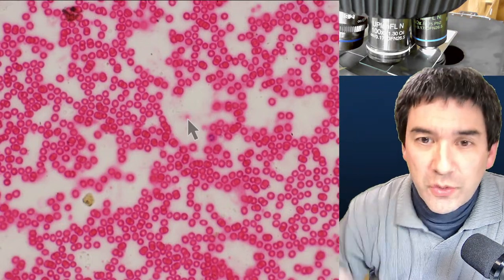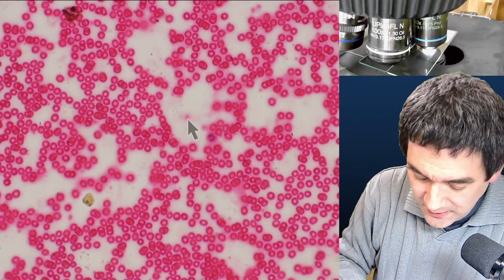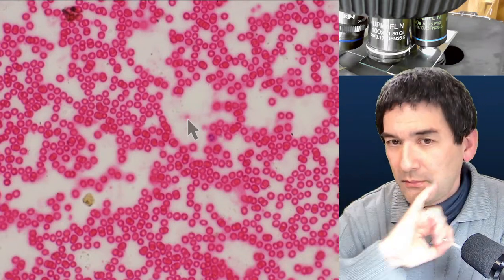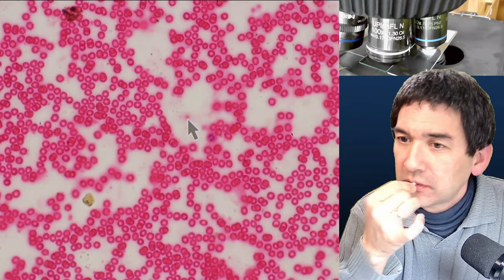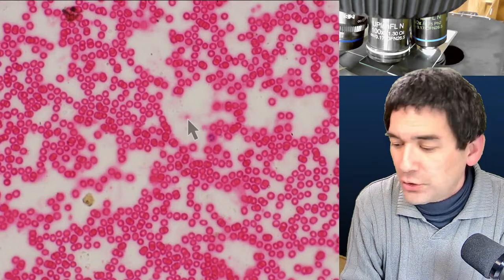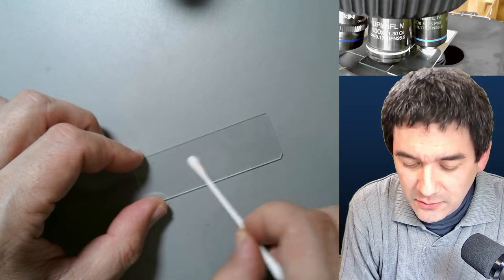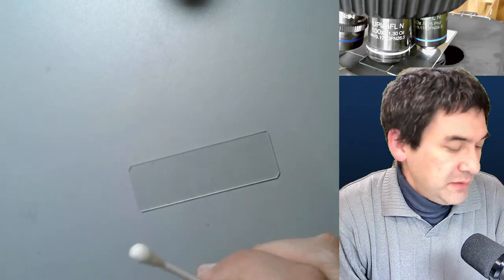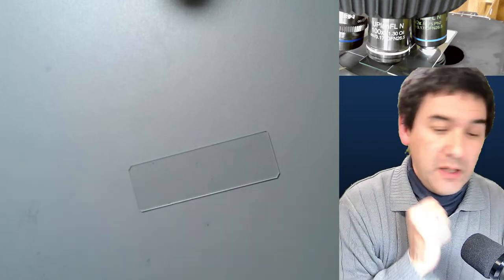Now I'll show you a specimen where phase contrast really makes a difference: unstained cheek cells. You can scratch some epithelial cells from the inside of your cheek using your finger or a clean stick. I'm collecting cells now and transferring them to a microscope slide, spreading the cell clusters apart a little.